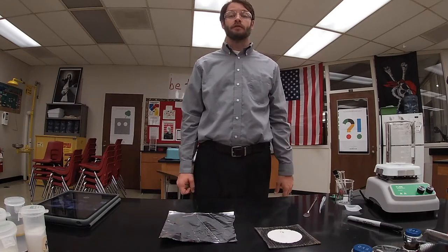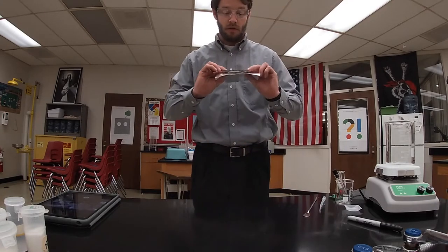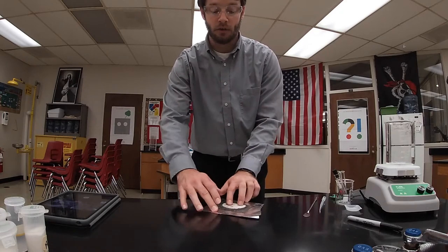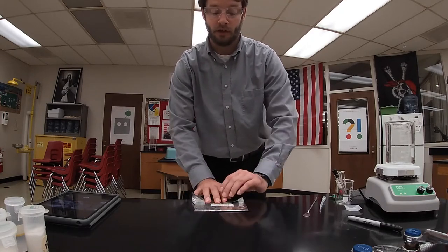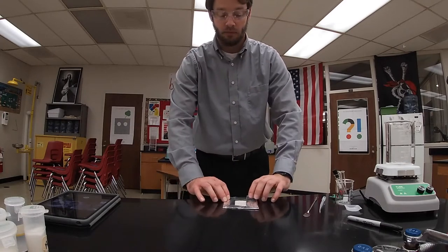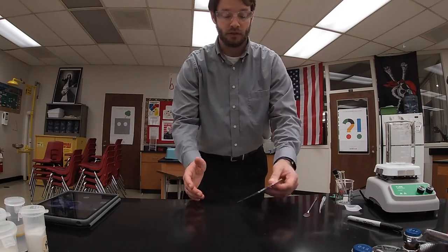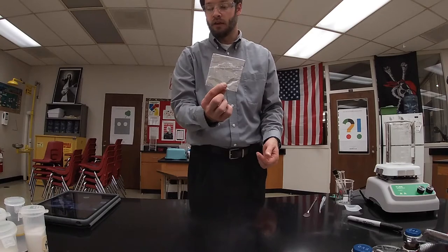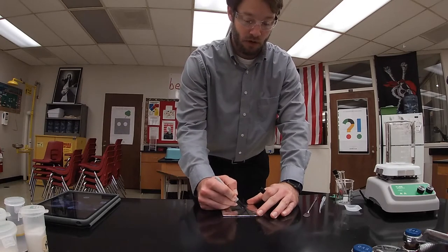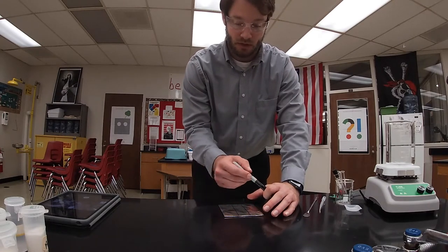The first thing I want to do is observe the properties: color and texture. I'm going to prepare my substances so I can determine their melting point. I'm taking a piece of wire gauze and wrapping it in aluminum foil. This will allow me to heat the substances on a surface that's not going to burn up. Now I'm going to take a Sharpie and make a tic-tac-toe board, which will give me nine squares to put each of my substances in.